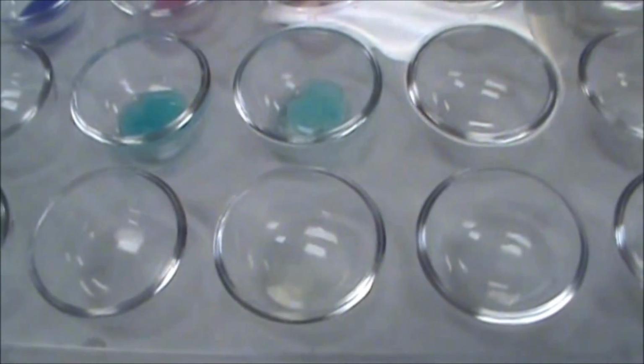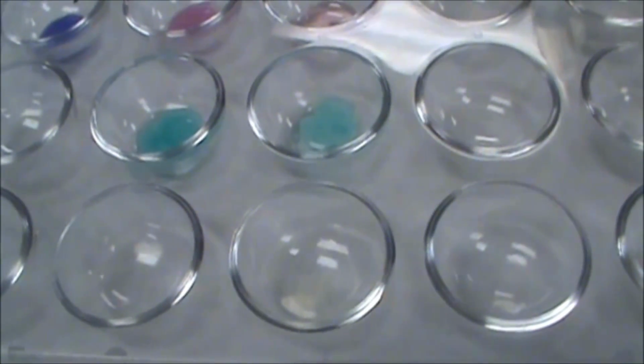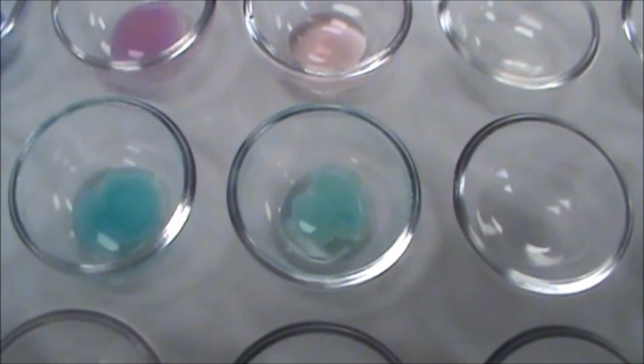So to really distinguish them, the other thing you can do is that when you have the phosphoric acid precipitate, you can smell some of the acetic acid being produced from there. So if you can get a smell of this, and you can sense that acetic acid smell, the vinegar type smell, that's your indication that you're dealing with phosphoric acid and not something else. It is difficult to differentiate, but there are some subtle distinctions.